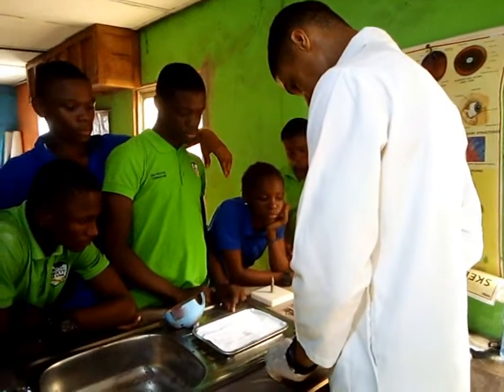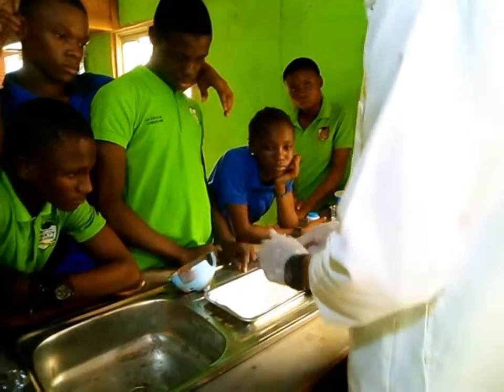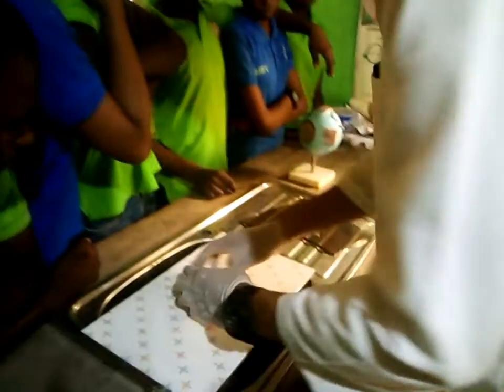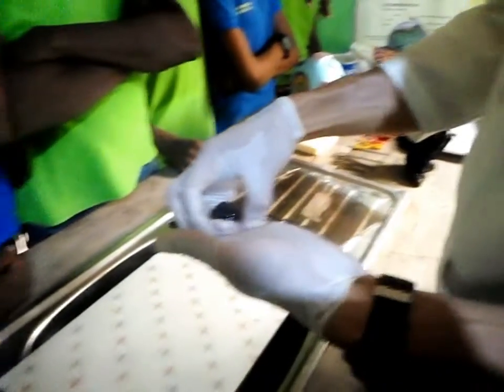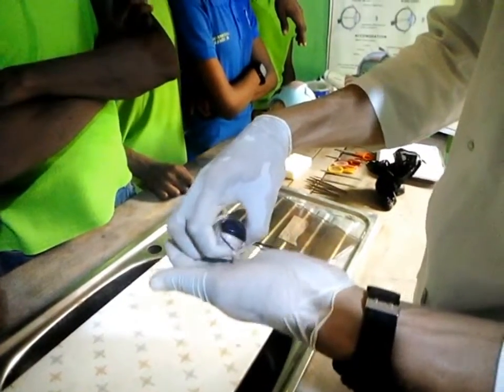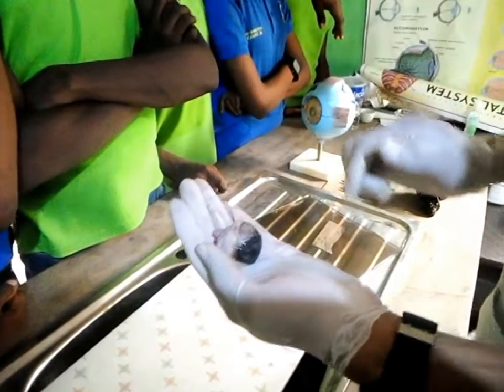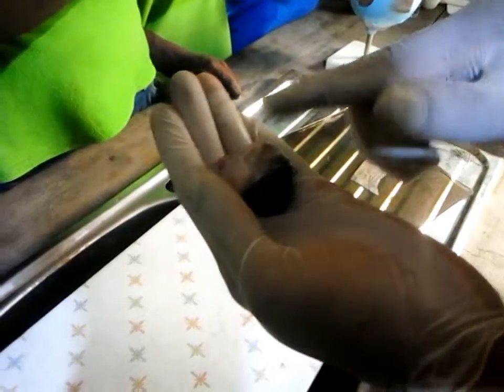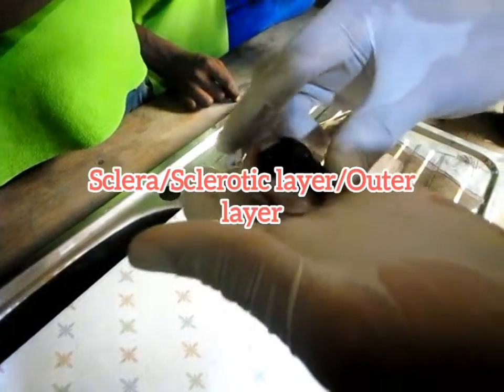Let's go to the dissection. Now, like I was telling you, we're going to be dissecting the eye of a mammal. So like I told you, I've explained each part of the eye. Now, if you look at this eye here, you see this eye has a white outer layer. This is the sclera. Are you getting me? Or sclerotic layer. Are you getting me?